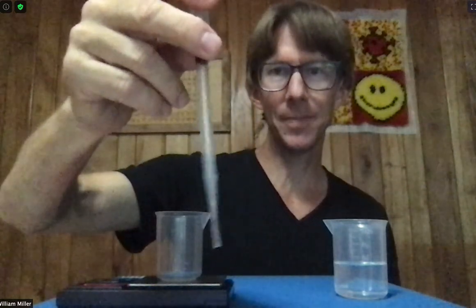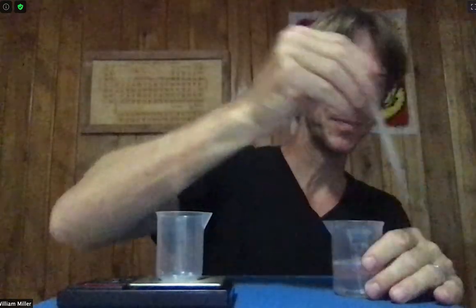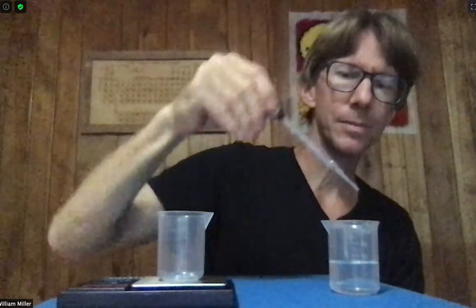Now I've got my pipette — it has distilled water in it — so I'm going to condition my pipette so it has this solution in it. I take a small amount, run it around inside, and then pour it to waste. I do this three times. Now whatever's in here is the same as this solution. Again, these little things do make a difference in this lab.